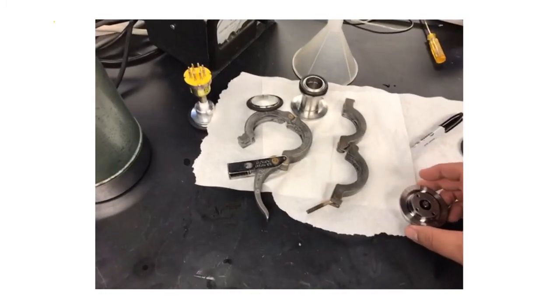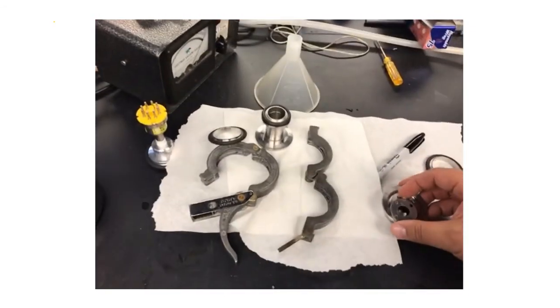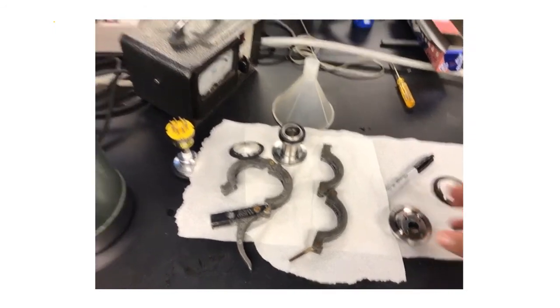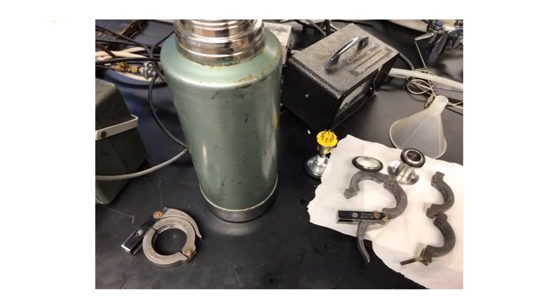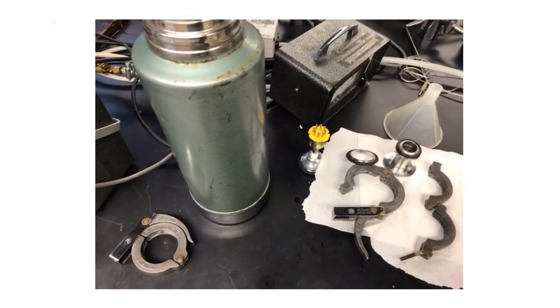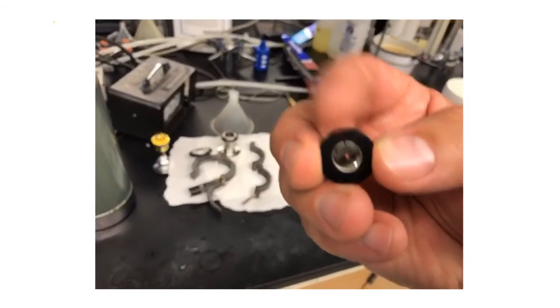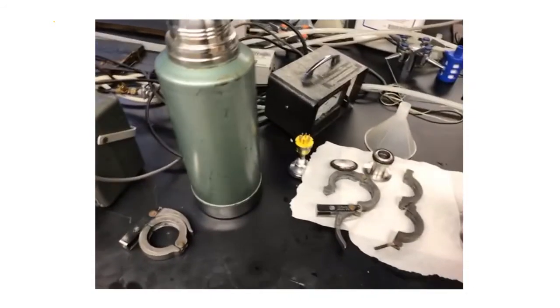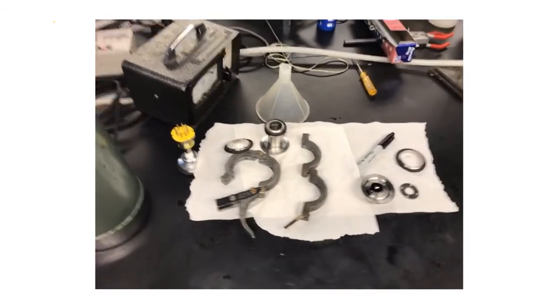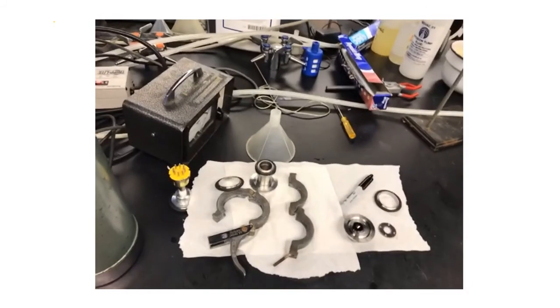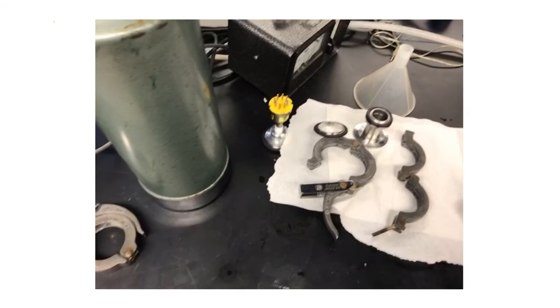What I would do at this point is get a mass of this entire cell with those pieces intact, so then later in the experiment you can take the mass with those pieces still intact. Get a mass with these three pieces. The reason I would say to get a mass with the cell already on it is sometimes you're going to get some deposition of material on top of the cell that you want to make sure you include in the sample mass before and after our trial. We're going to get the mass before the trial and get the mass after the trial.